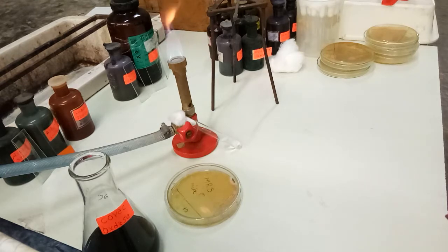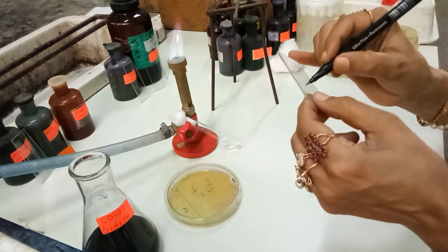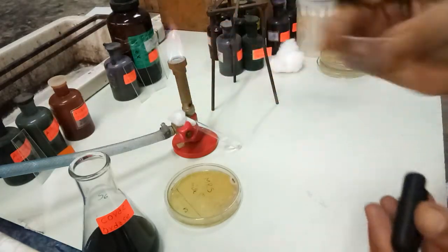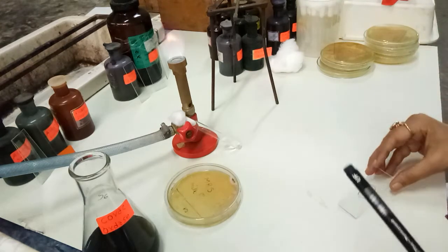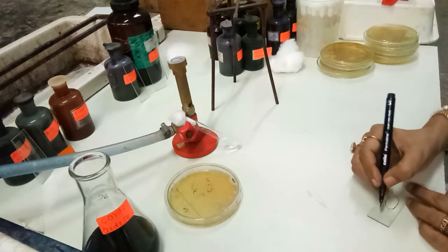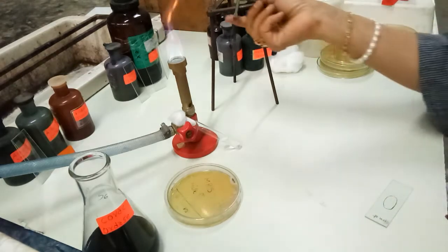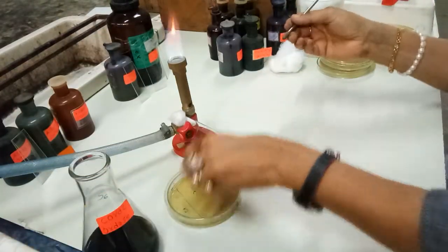By the time the wire cools, I will make my slide ready. I will make an oval-shaped circle on the slide, which will be helpful for making the smear for Gram staining. I will do this type of marking on the slide for other stainings also. Now my Nichrome wire has already cooled down.